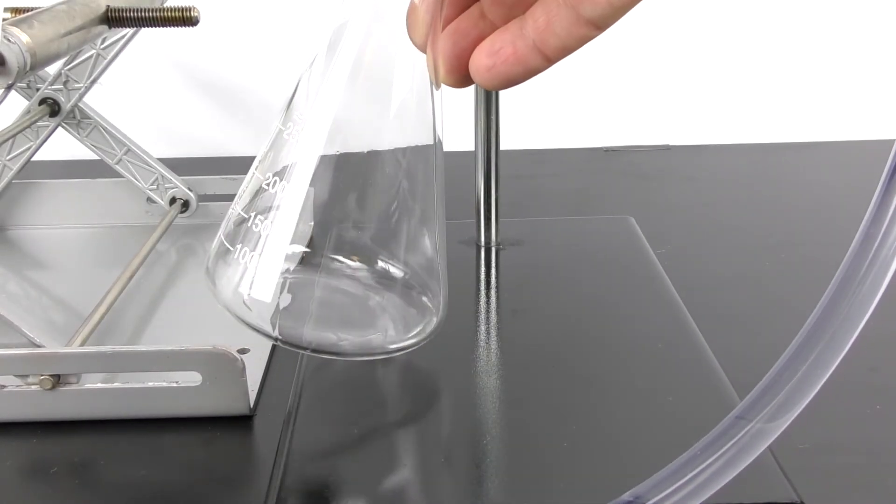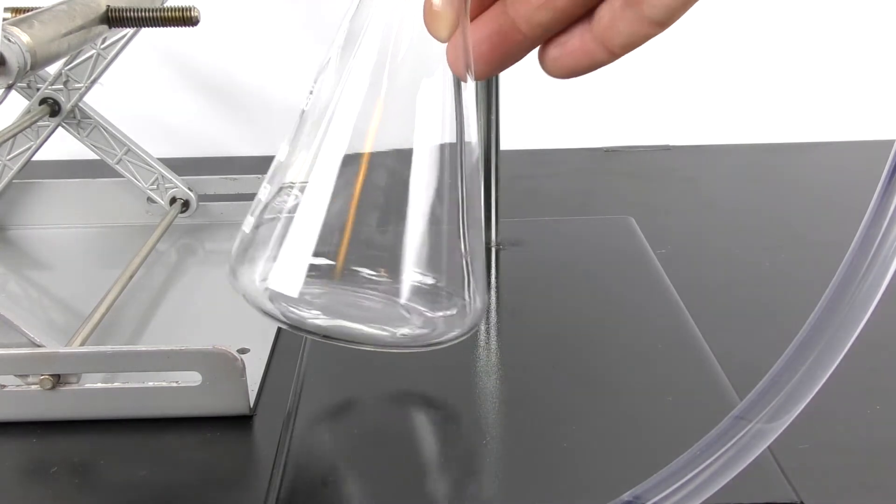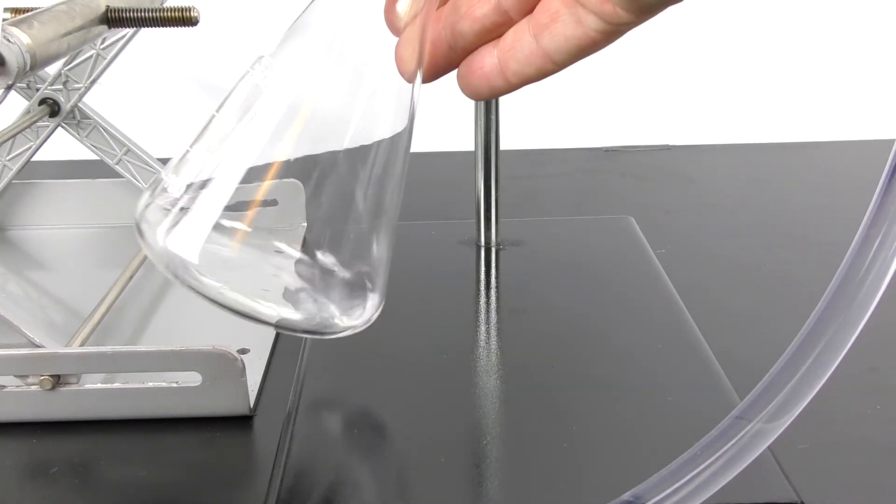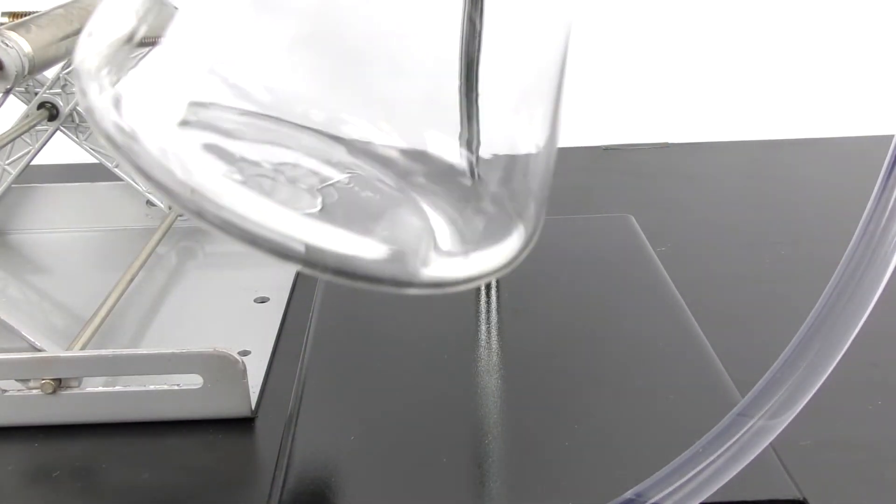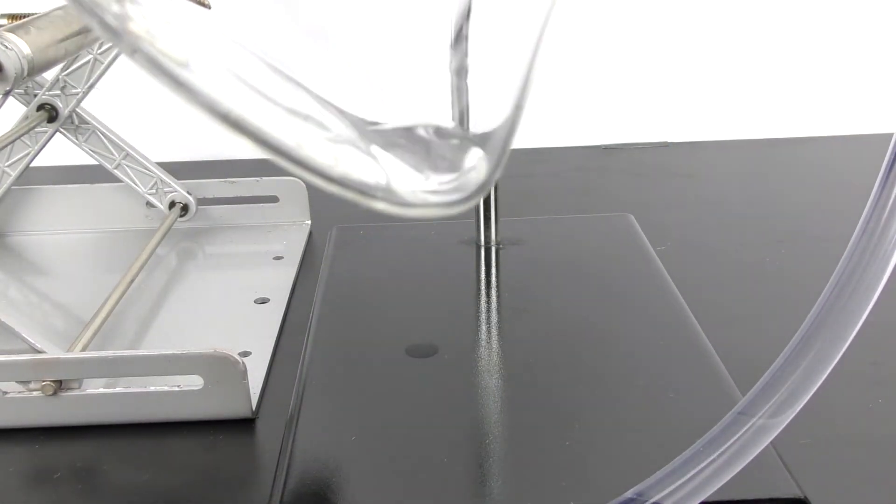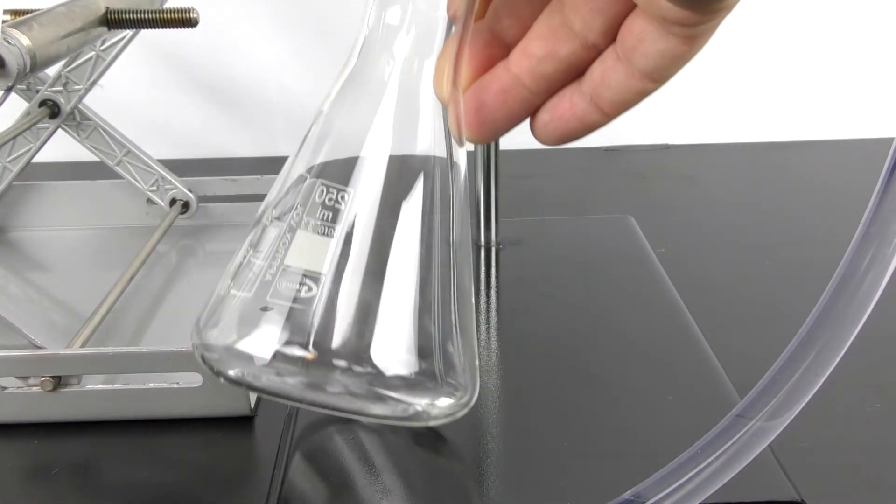Now partway through the distillation I switched to a smaller collecting vial because this kept evaporating on me, but I did get quite a bit of pure alcohol out of there.